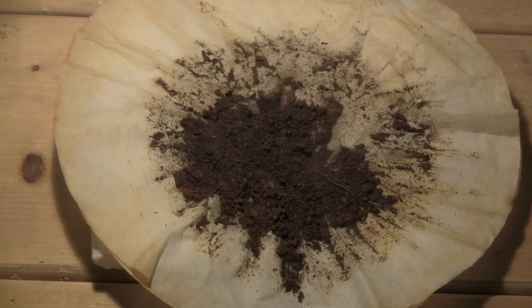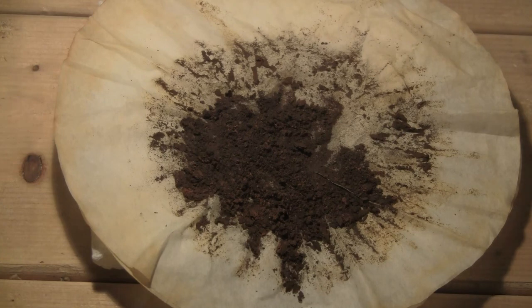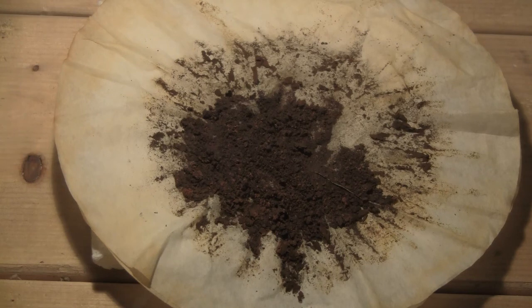The final yield was 4.979 grams of copper powder, which is above the 100% yield, which means the powder is still a little wet, but the reaction should be quantitative.